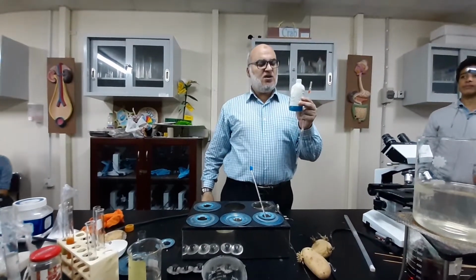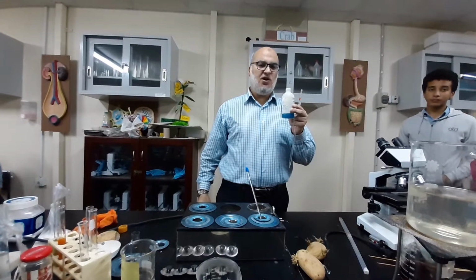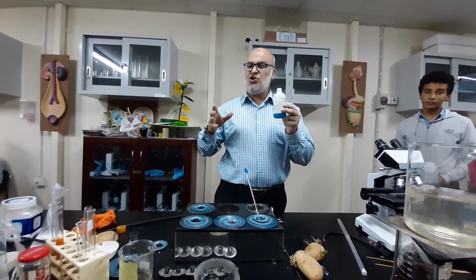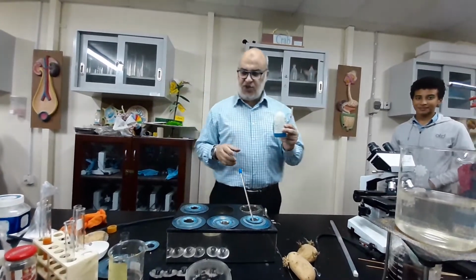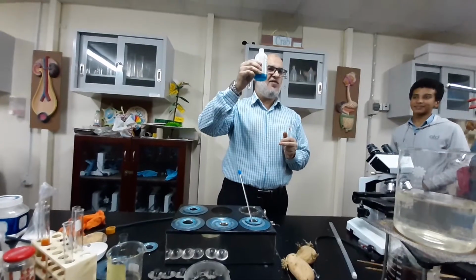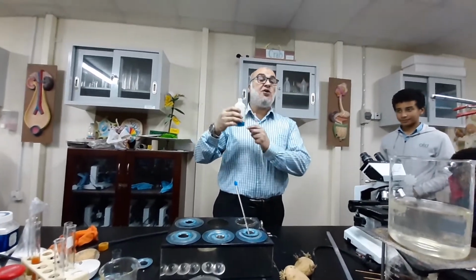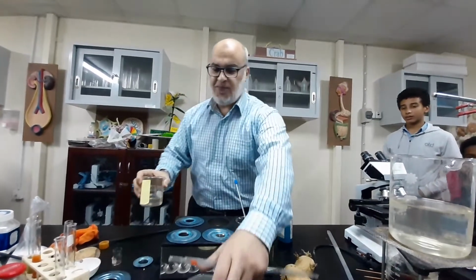In case there is a reducing sugar, it's gonna change the color. The color change you're gonna observe when we do it today. What we need for this investigation is the reagent, the most important stuff, Benedict's reagent, whose color is blue, and two kinds of sugar.